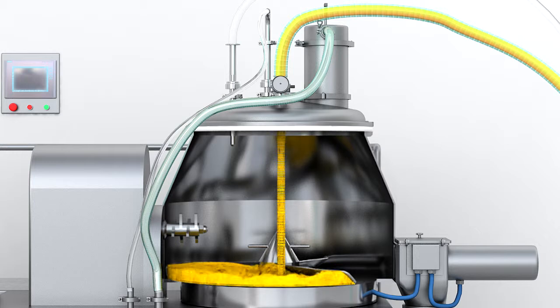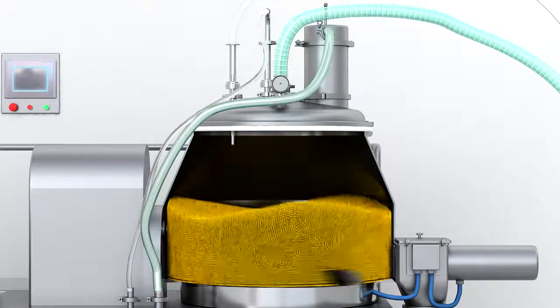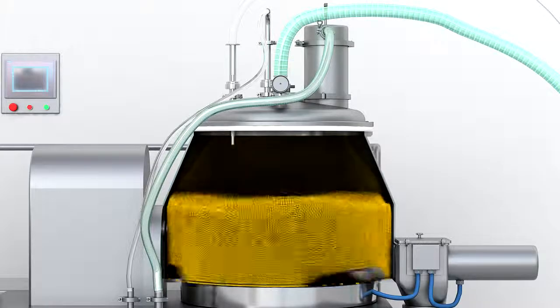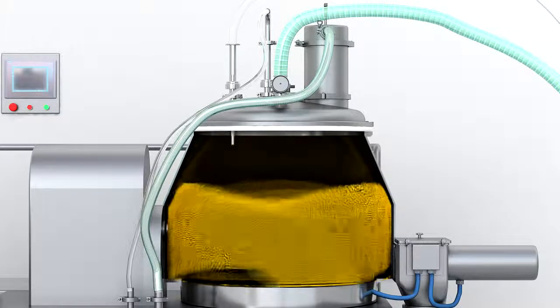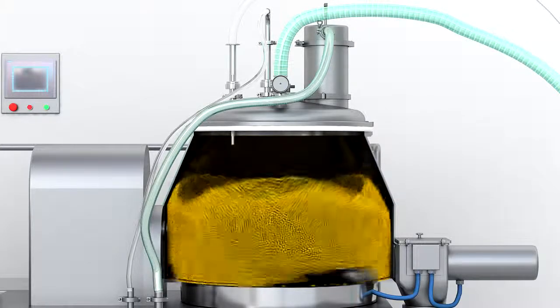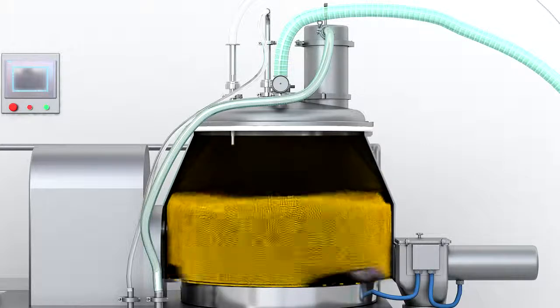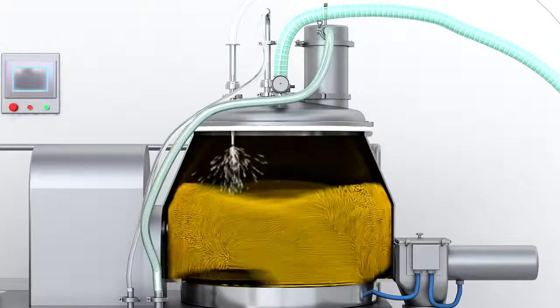After finishing material loading, the loading valve closes, the exhaust valve opens, and the gear motor drives the impeller to make materials move along the inside of the container. The spiral tangential force generated by the rotating Z-shaped impeller pushes materials to turn over from the center of the container and move toward the side wall, and the materials change movement direction under the force of the hook of the impeller edge and the side wall of the container.